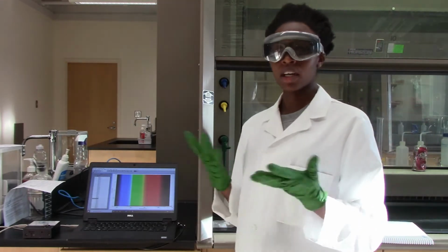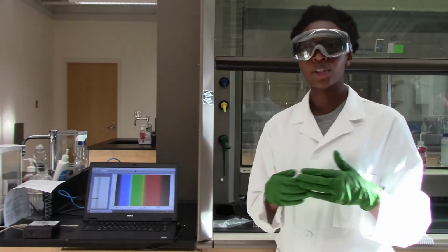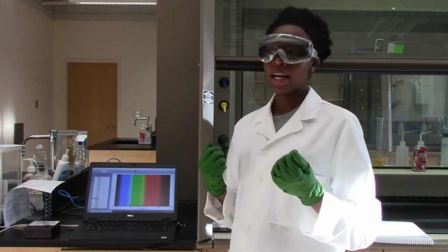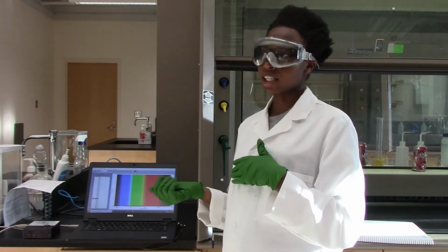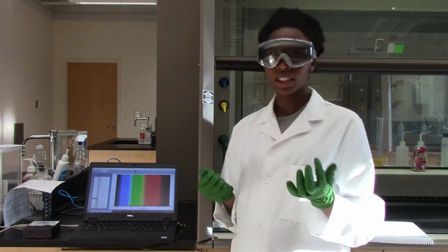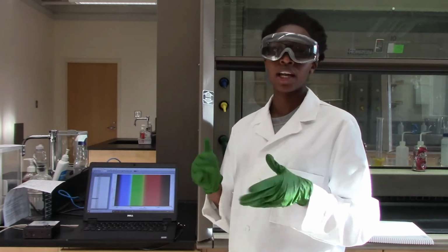Food coloring dyes are common, and dyes absorb light, and so what chlorine is going to do is to decolorize the dye so that in the course of the reaction the dye will lose its color and therefore its ability to absorb light. And so we are going to monitor the absorbance versus time of the reaction that we are going to collect today. And we will use this data and the various integrated rate law expressions that are outlined and explained in your manual in order to determine the order of reactions and get the rate laws and other parameters that we need to examine.